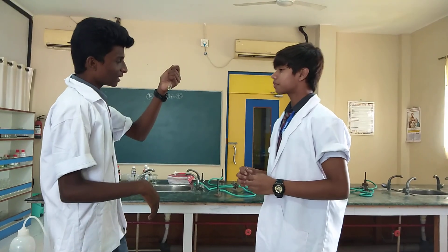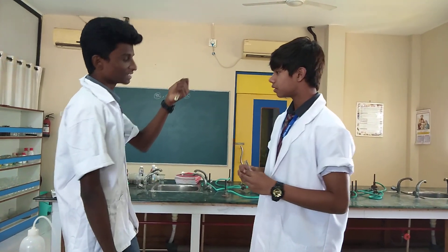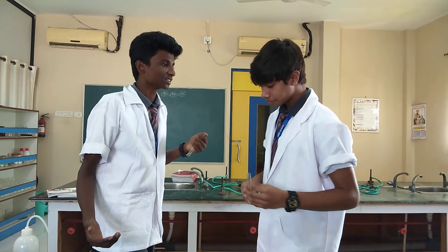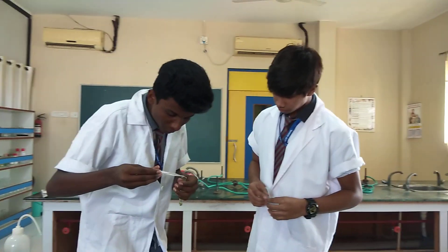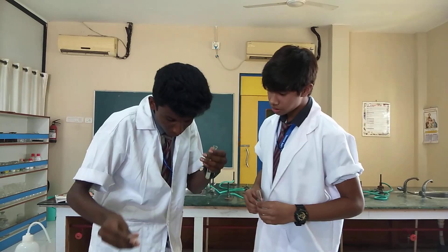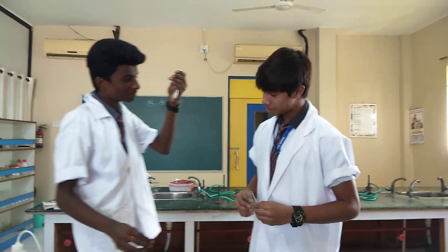I have a zinc sulphate solution with me. Let's check what will happen when I add NaOH to it. I got a white precipitate.